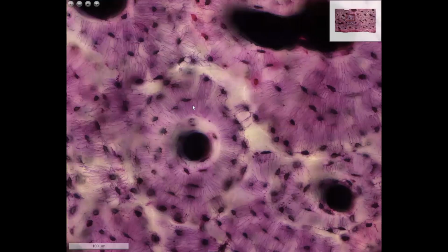The Haversian lamellae are made out of collagen fibers and amorphous ground substance. This ground substance is mostly inorganic, like the hydroxyapatite crystals. The cells appear as narrow little slots here.